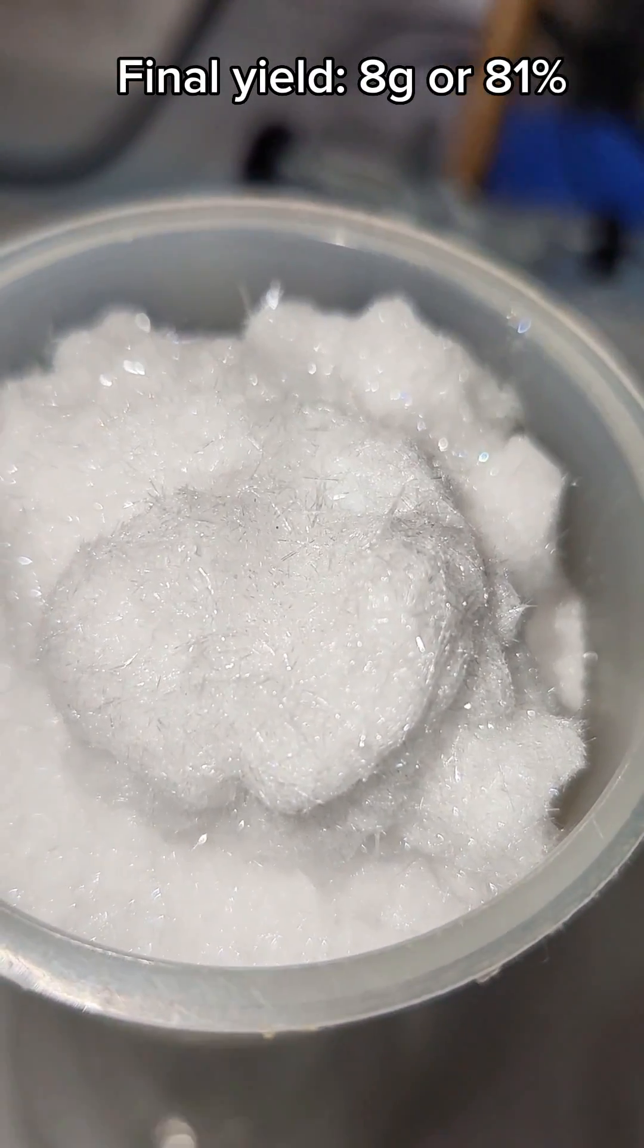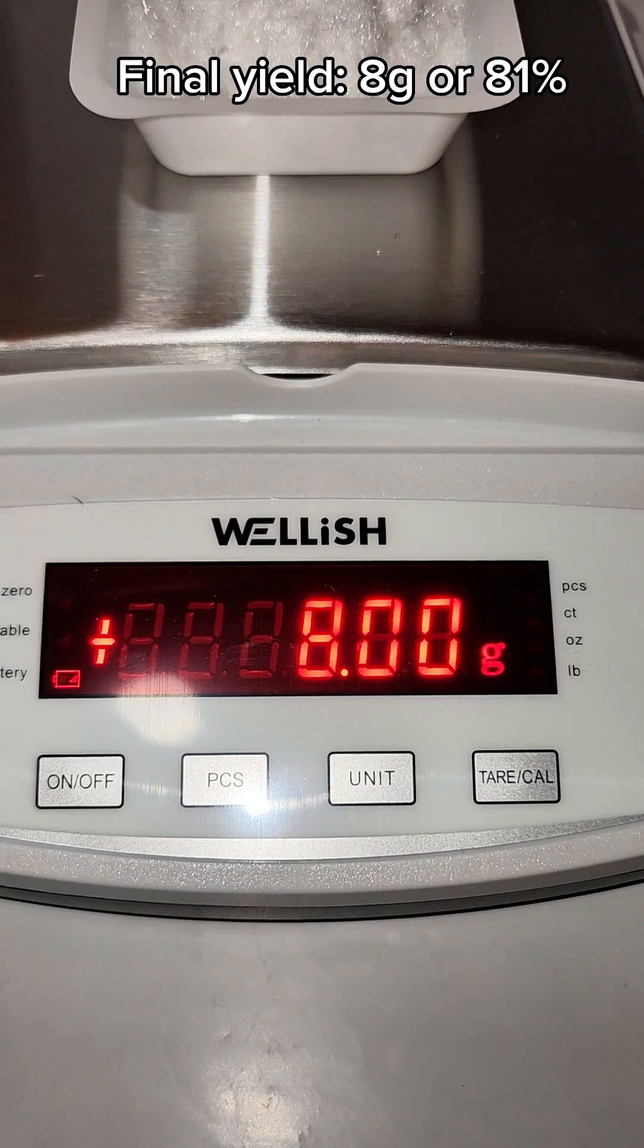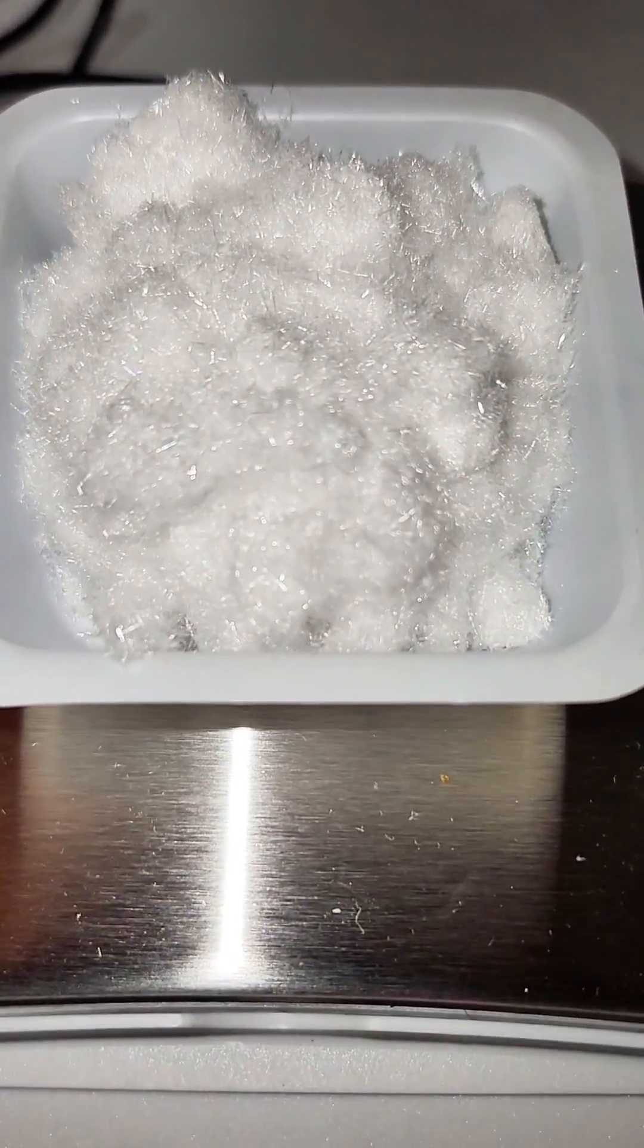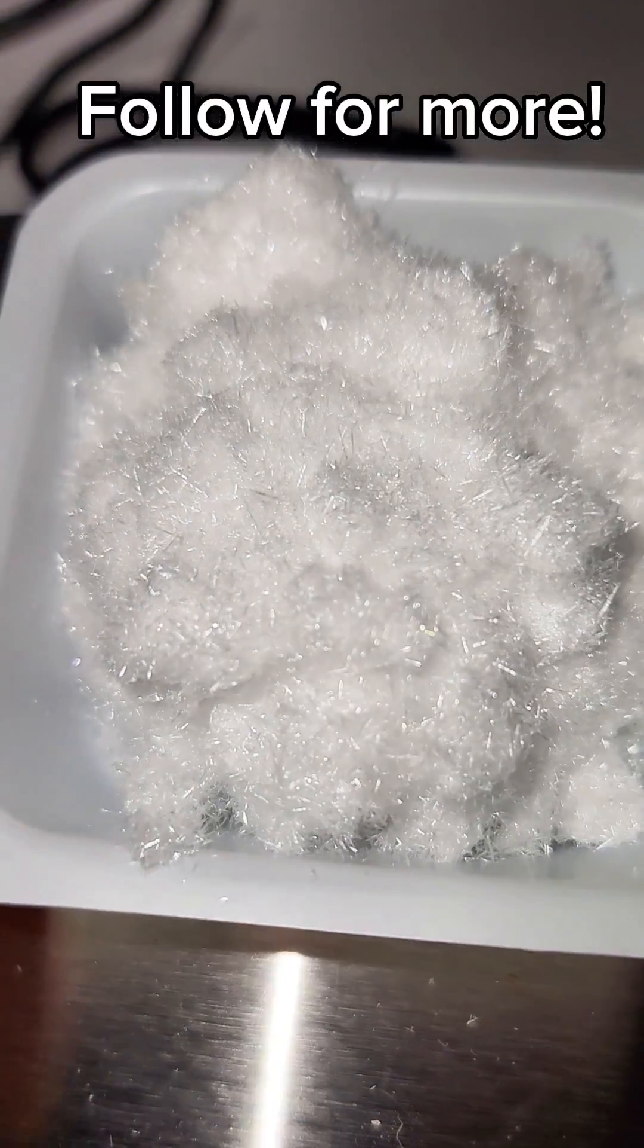The initial yield was probably a good deal higher, and as usual, I probably lost most of my product in the recrystallization. Regardless, I hope you found this interesting, and if you'd like to see more science, consider giving me a follow.